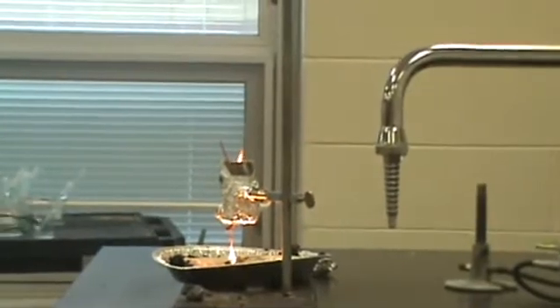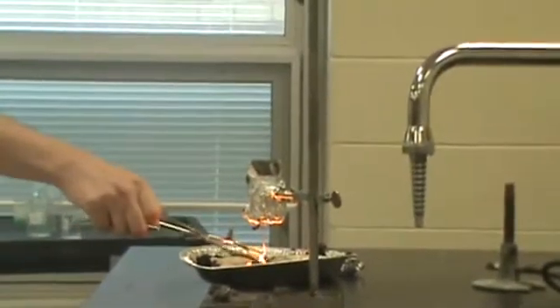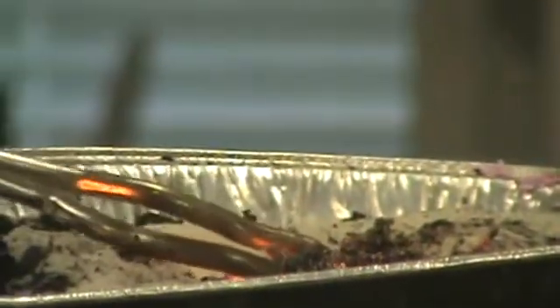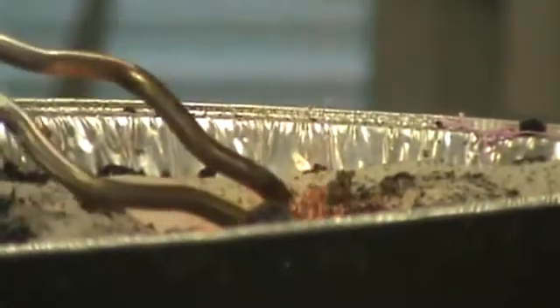That was the drawback — so that's liquid iron right there. Let me get this out. Oh, that's so cool. I think it's gone through my sand, so I'm not going to be able to pick that up. It started dripping. That didn't hurt at all — that was crazy. So I just cut a hole open in it. If you want to come up and look at that, I can't actually pick it up — I think it's sealed to the thing.